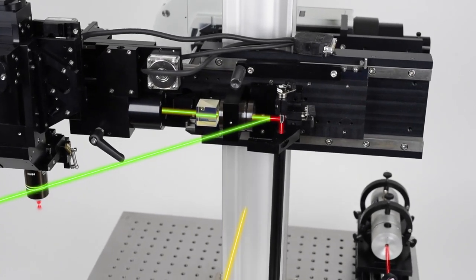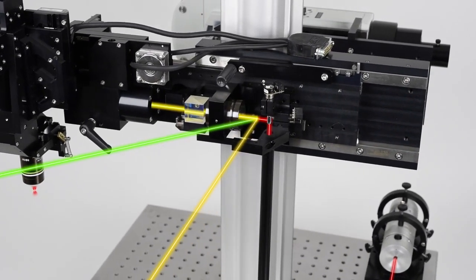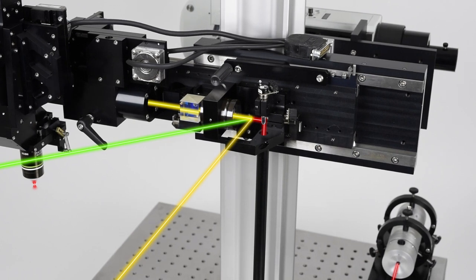Finally, 2 additional laser beams can be added to the system between the actual scanners and scan lens via a scan lens dichroic input. There is an engineered location to accept dichroic mirrors to couple 1 or 2 more light sources into the scan lens.